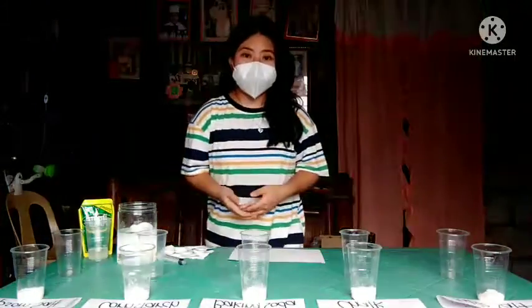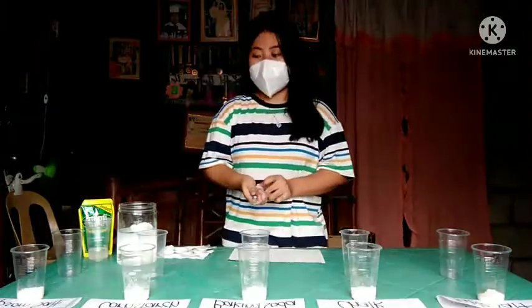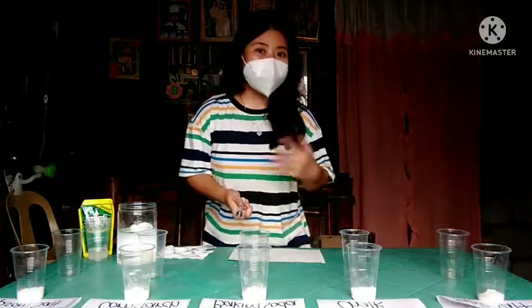So, dahil napakilala na lahat ng mga materials to be needed and the chemicals, let's proceed to the experiment proper. The first thing to do is to put 10 ml water in each cup, and after that, maglalagay tayo ng small amount of chemicals sa bawat plastic cup. Then after that, we need to dissolve it. So, tara, samahan niyo.